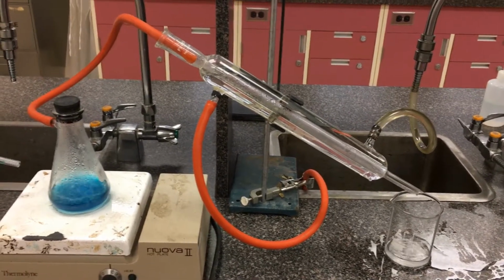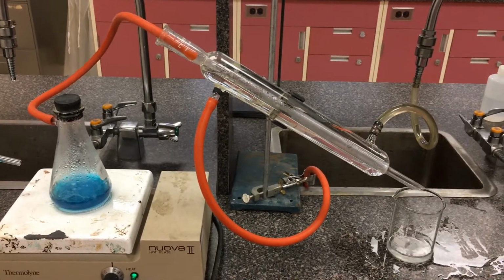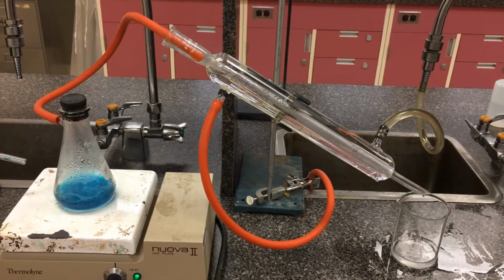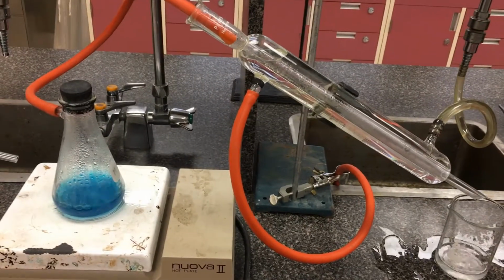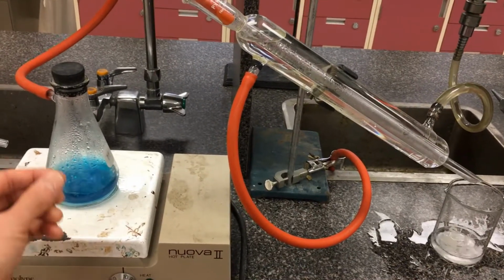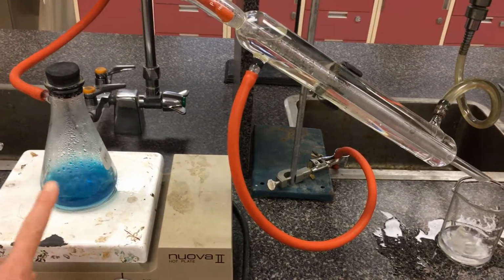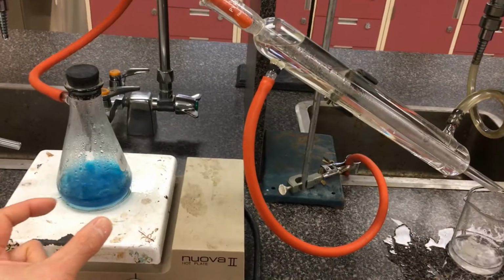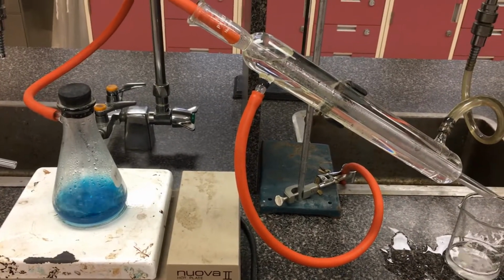Because our aldehyde intermediate only has dipole-dipole intermolecular forces, it doesn't have access to the hydrogen bonding that the alcohols or the carboxylic acid has. It's going to be the first chemical that boils off. So imagine I have a primary alcohol in there, I have the acidified dichromate here oxidizing. As I create the aldehyde, it is going to be the first thing that actually boils off, separating from our starting primary alcohol, as well as perhaps some carboxylic acid that eventually gets formed.